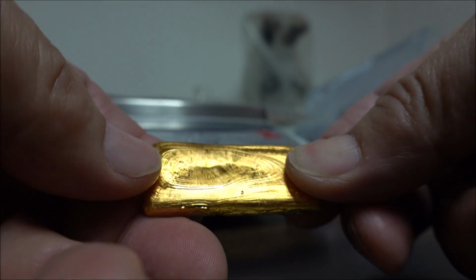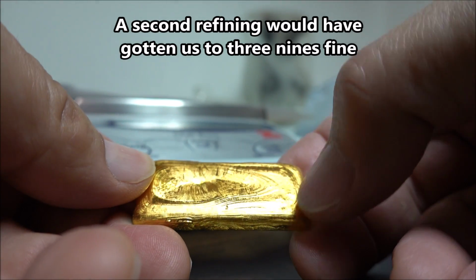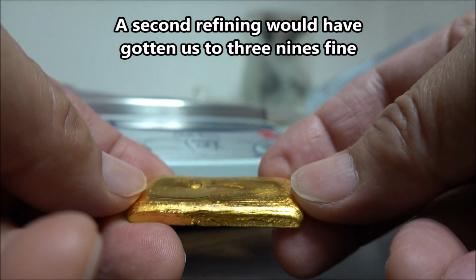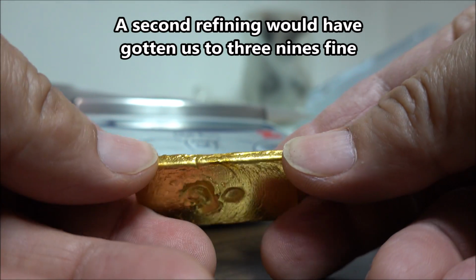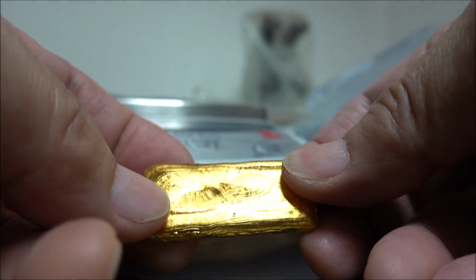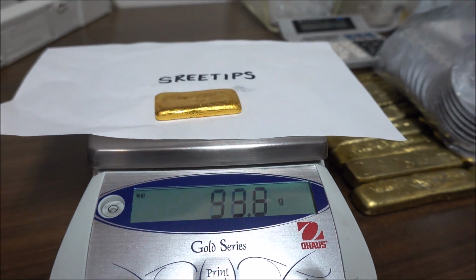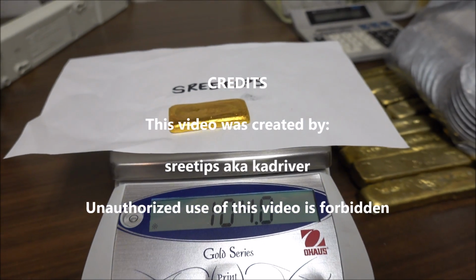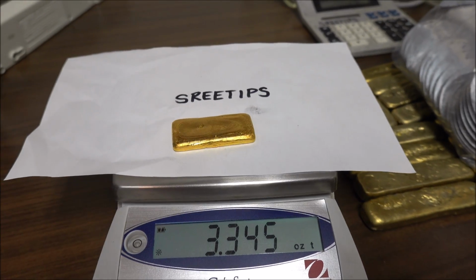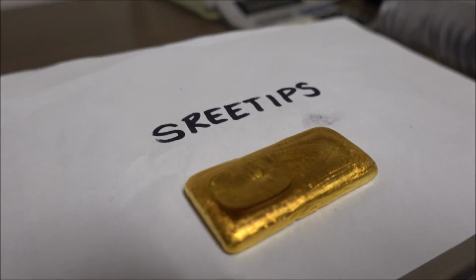Here's our pure gold bar. Probably 99% pure. You can see some irregularities in the surface there. That's probably some silver from that silver chloride that came over before I precipitated the gold. Now we're going to get a weight on this thing, see what we got for a weight. It's 104.0. It's 3.3 troy ounces of pure gold, probably 99% pure here.